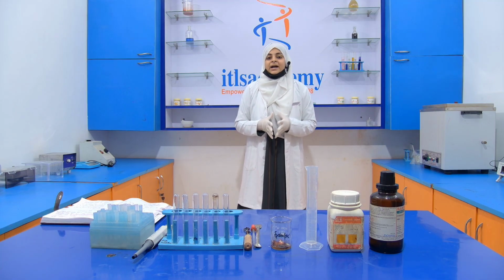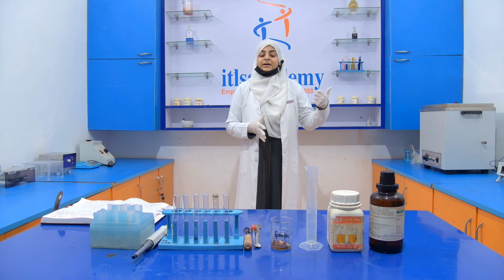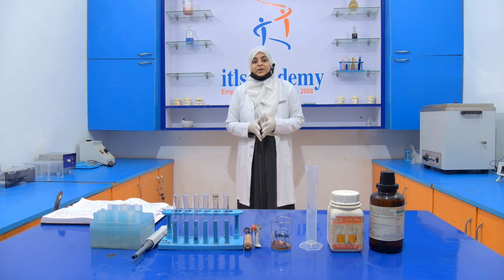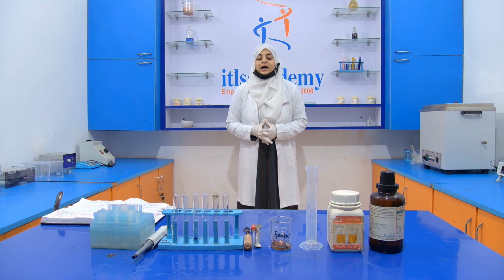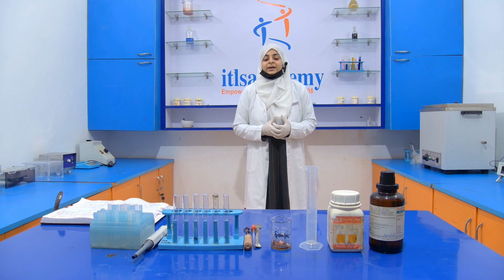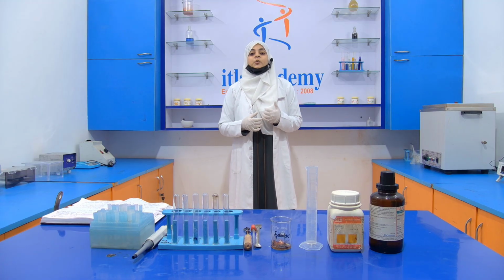How do we extract this fat with the Soxhlet method? The video related to this is already uploaded in our account. You can check it and see how we extract it. Here I'm just giving you a quick recap.